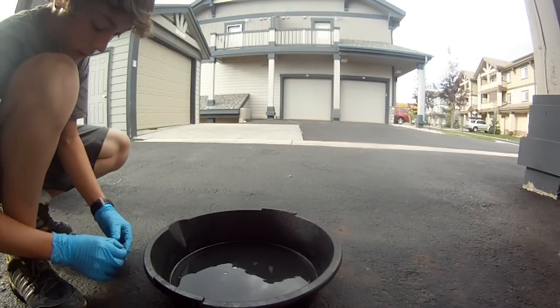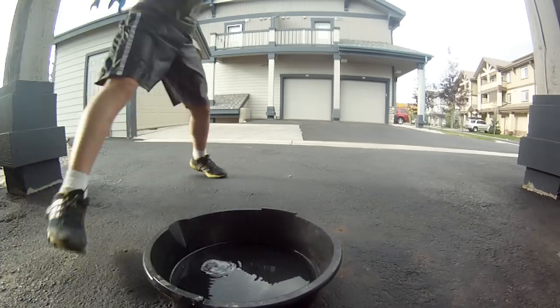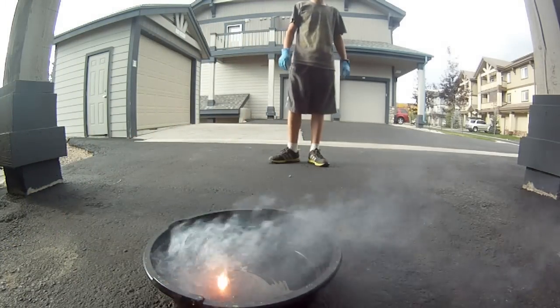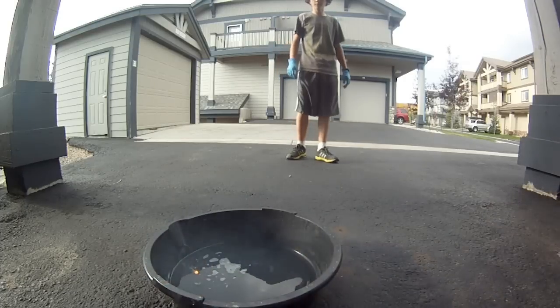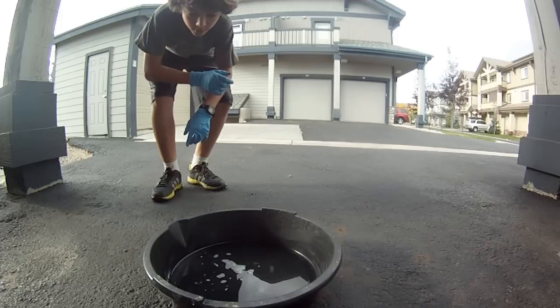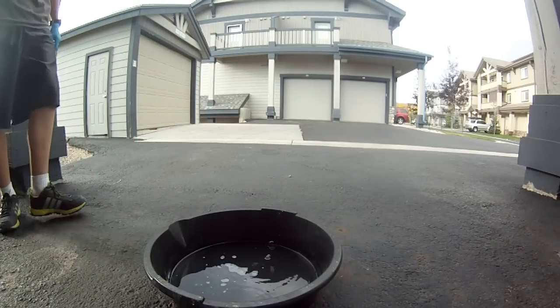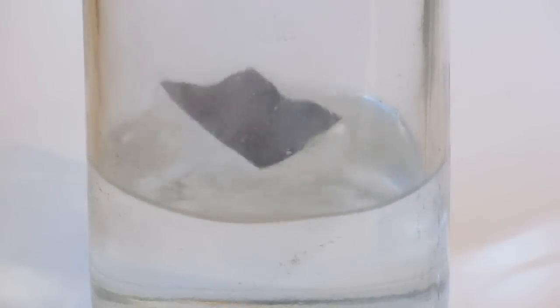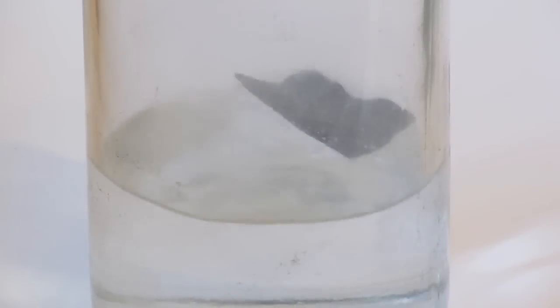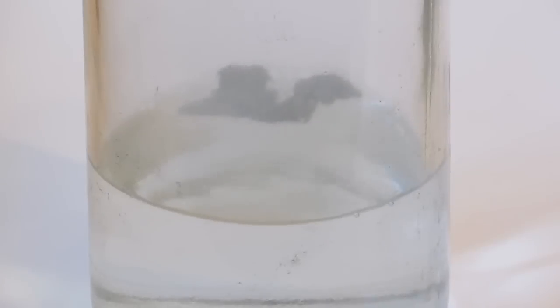For this, you simply take the lithium metal and place it inside of the water. You can see the hydrogen bubbles, and they very quickly ignite because this reaction is so exothermic it ignites the hydrogen. You can see it's balled up because the lithium is molten right now on the water surface, and there it explodes. This is a close-up — you can see it's bubbling very vigorously inside this jar. This has a very wide surface area because this is lithium foil, so it reacts very quickly and almost disappears.